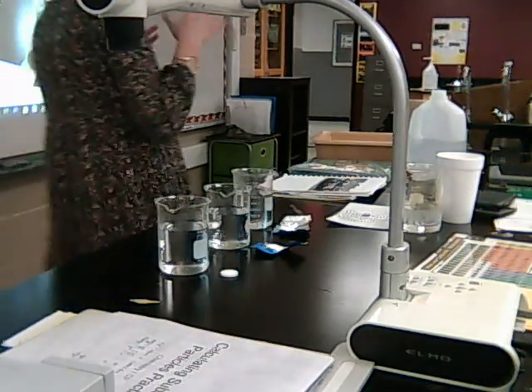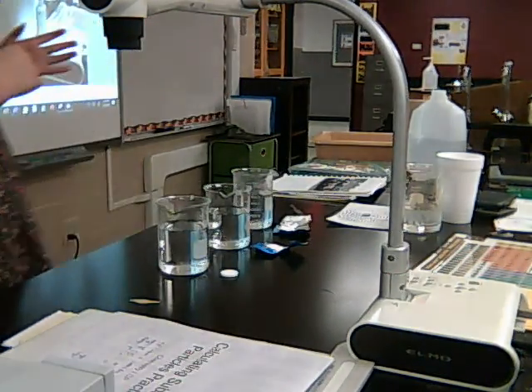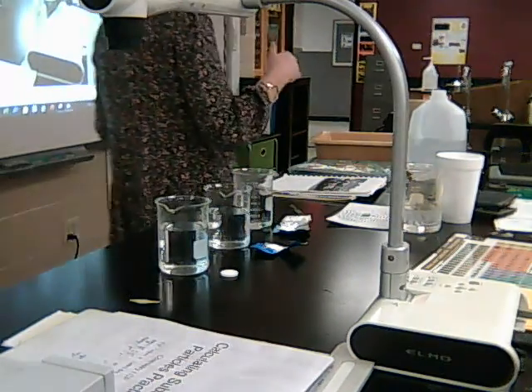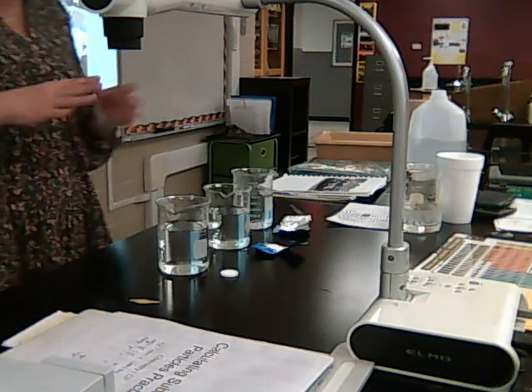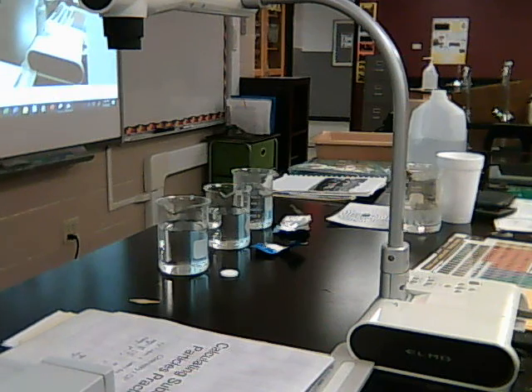Right. I'm going to time how long it takes them to, I'm not going to say dissolve, I'm going to say disappear, because this is a chemical reaction. Dissolving is not a chemical reaction. We'll learn this later on, it's physical. And we want to talk about a chemical reaction here, so we're going to say they're going to disappear. Okay? So we're going to time how long it takes them to disappear. All right? So I'm going to use my phone for that.